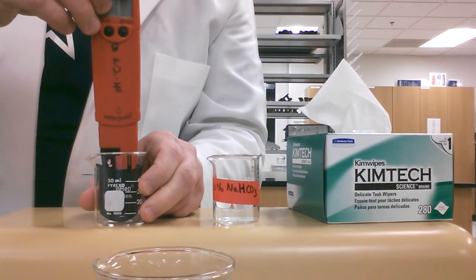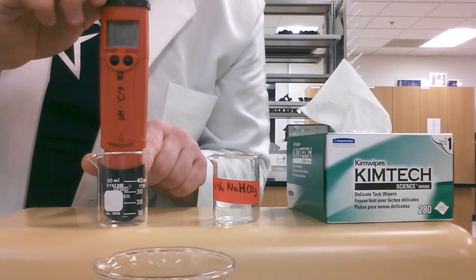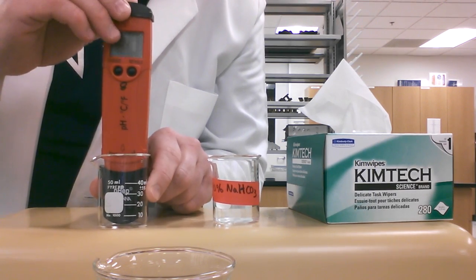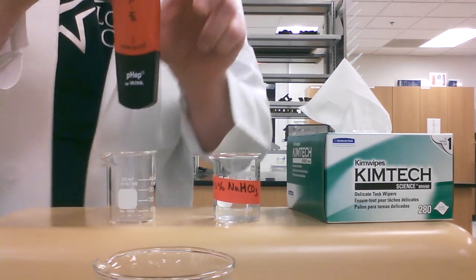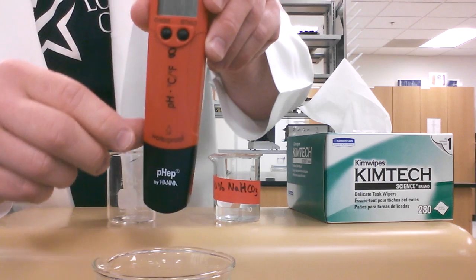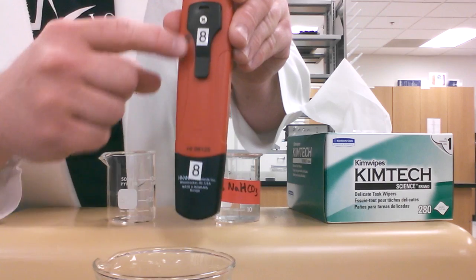Once it's turned off, you can now put the cap back on. You can do this by leaving the cap inside the beaker that you had it in and pushing down to snap it on, or you can do it with your hand. You know which way the cap's going to go on by looking at the numbers, so the numbers should both be on the same side. That's how you're going to know which way the cap goes on.